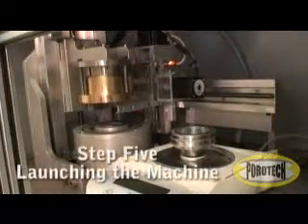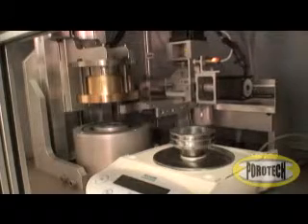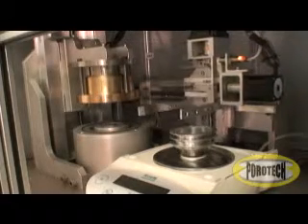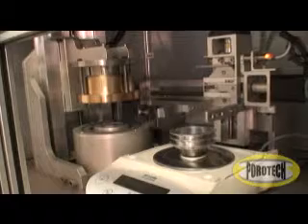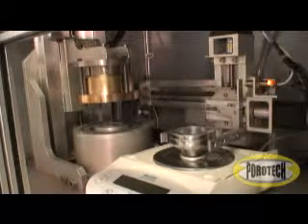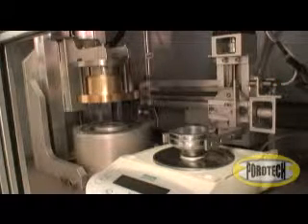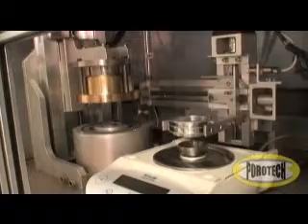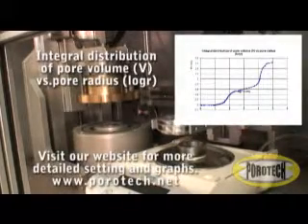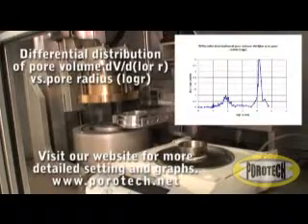Step 5. Launching the machine. The machine begins operation by taking the stack of 3 holding cups from the balance and transfers them to the testing chamber. The operator enters the temperature and compression settings. These settings simulate a wide variety of realistic environmental conditions.